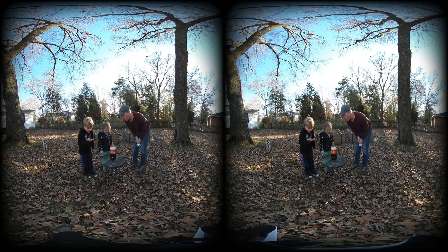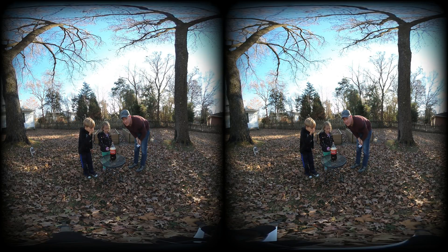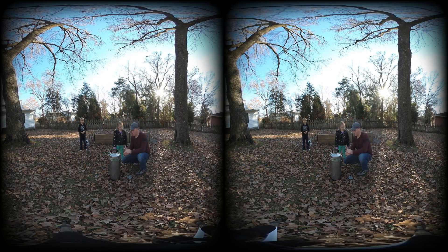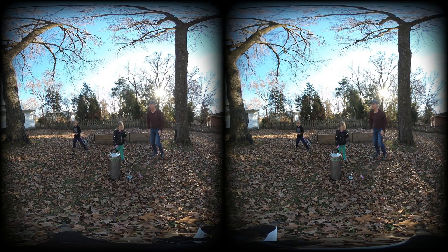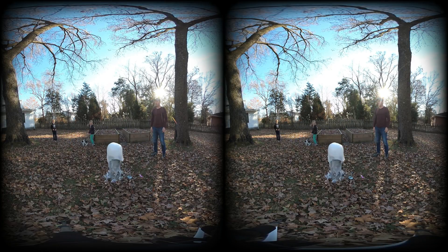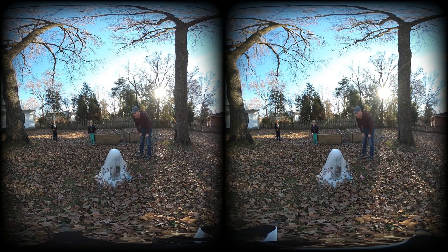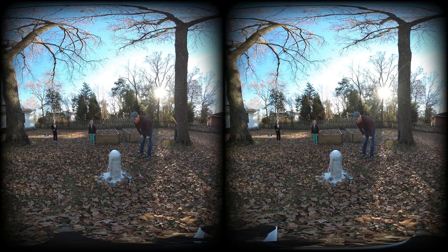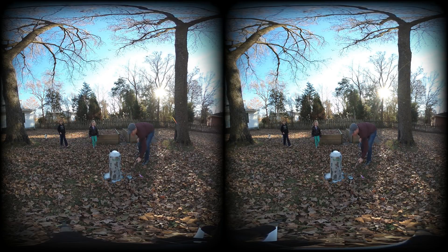Ours wasn't quite the geyser that we've seen online. You guys ready? There we go. Is that beer? What is it? It's water.